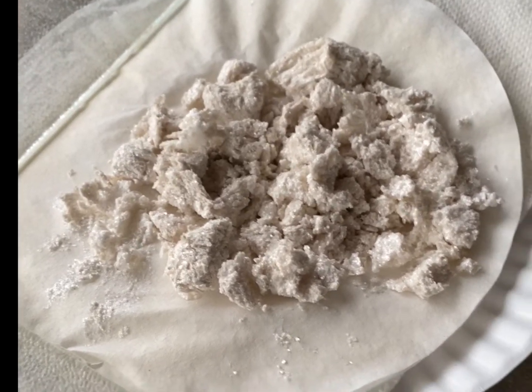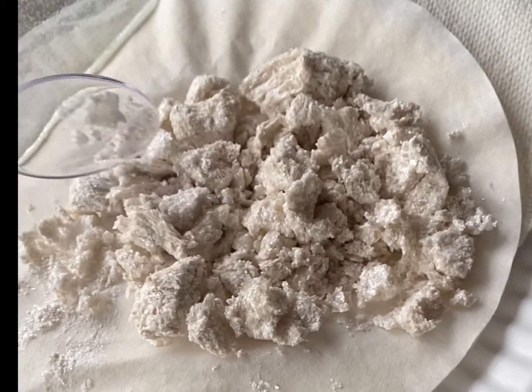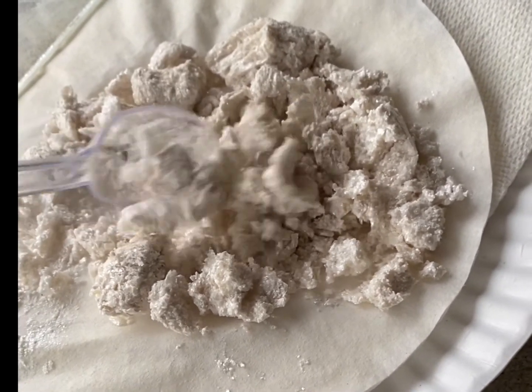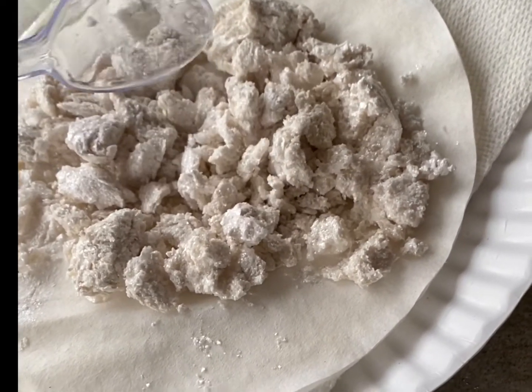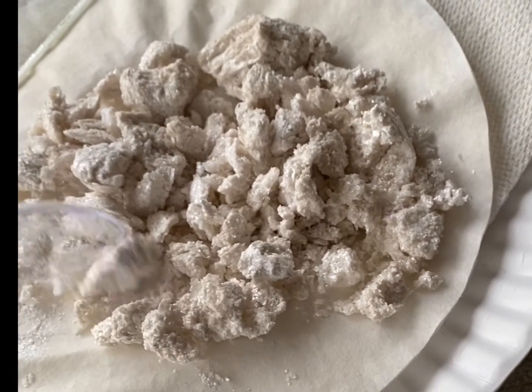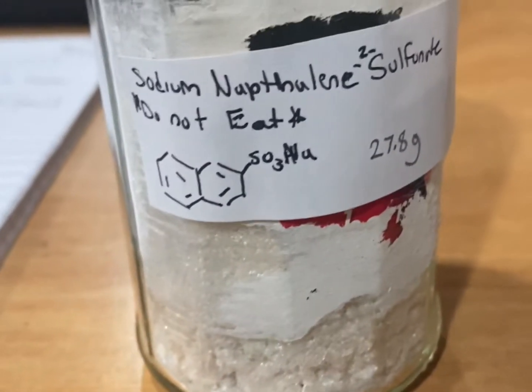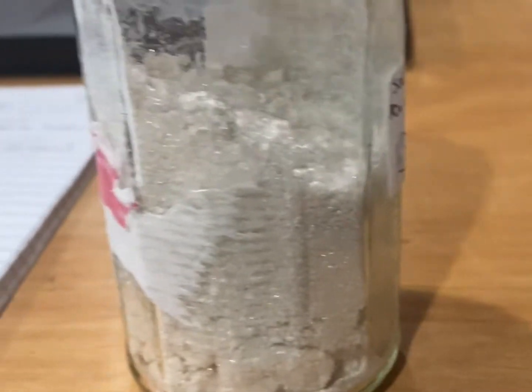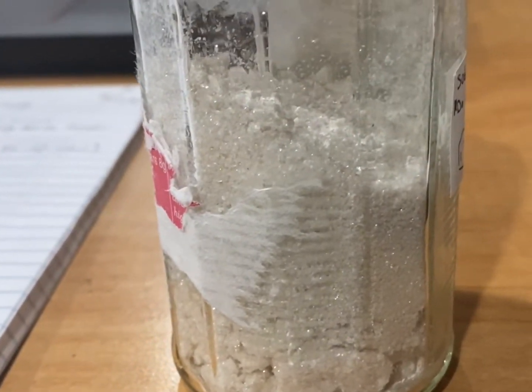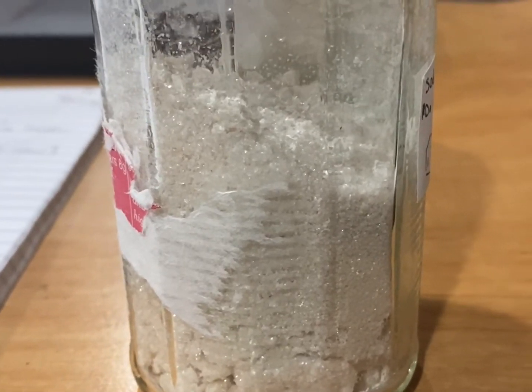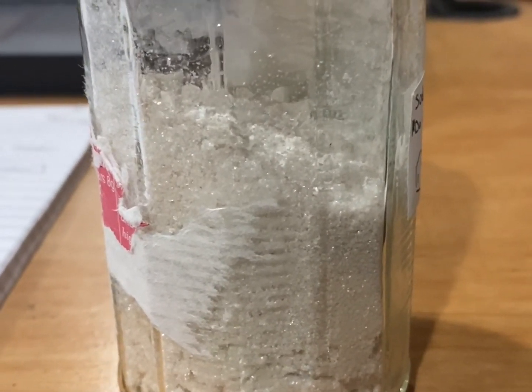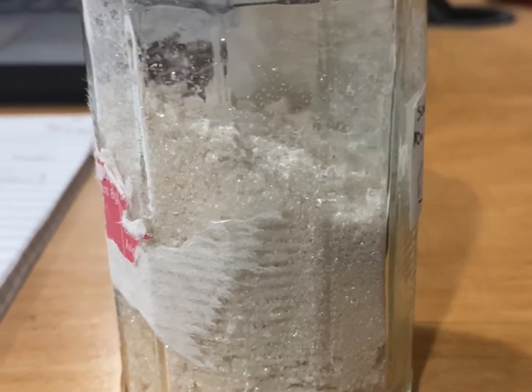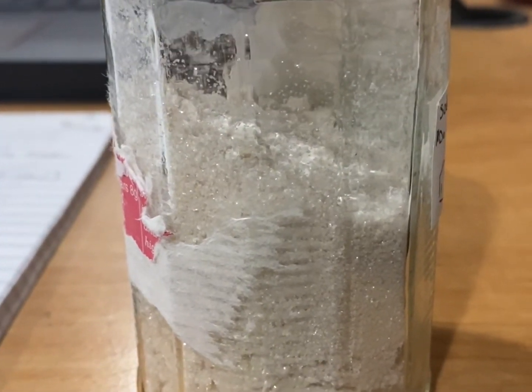So, here is our nice dry crystals. And now I'm going to weigh it out and see how much we got. Here is our final yield of crystals. We got around 28 grams. It's about 53% yield. I think the recrystallization from water lost us a lot of product. So, maybe don't use water to recrystallize it in the future. Yeah. Hope you enjoyed. Have a good one.